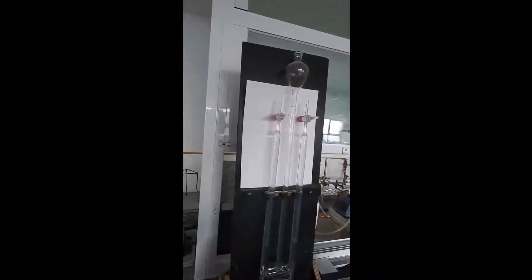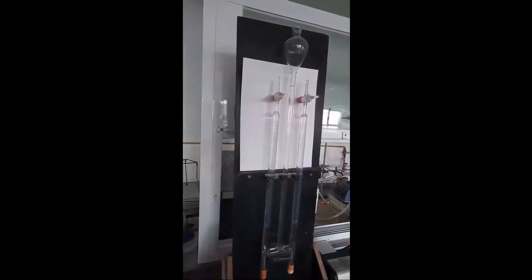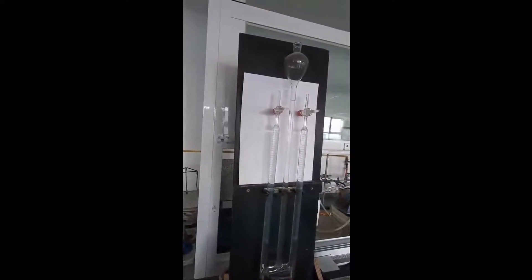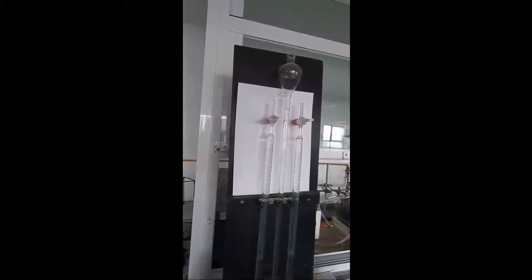We've just shown that the tube on the right had hydrogen, and the tube on the left had oxygen. We had about twice as much hydrogen as we did oxygen.